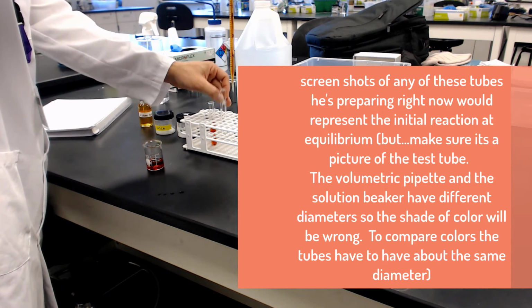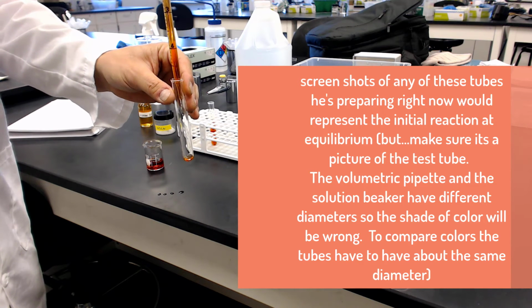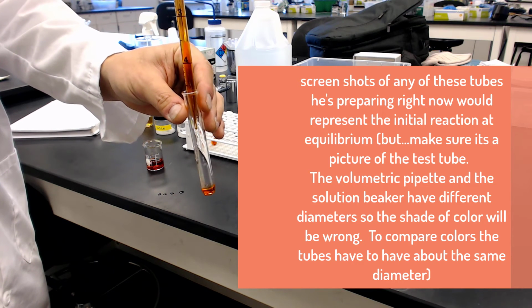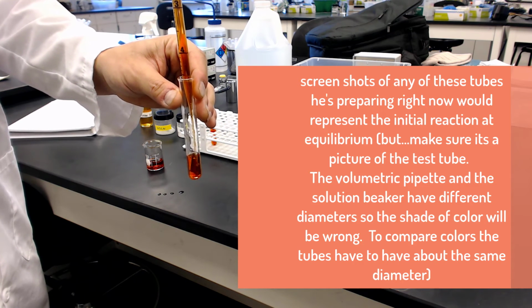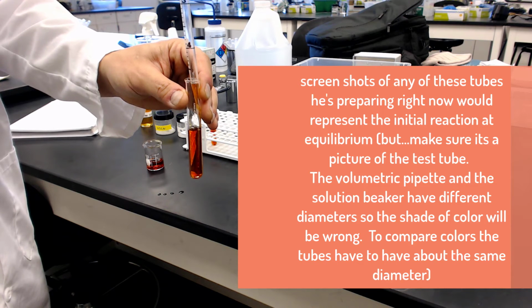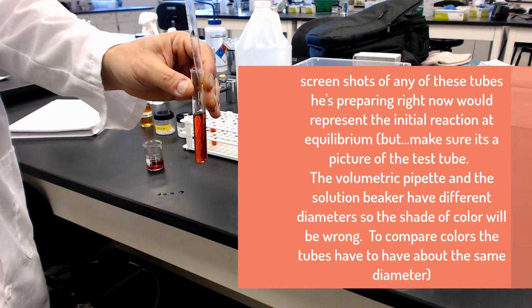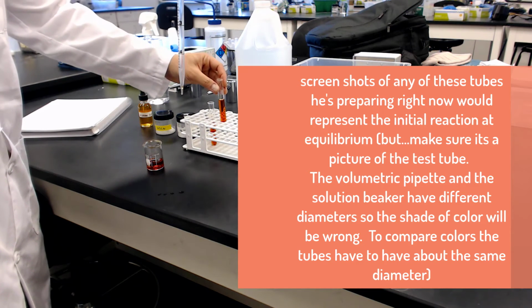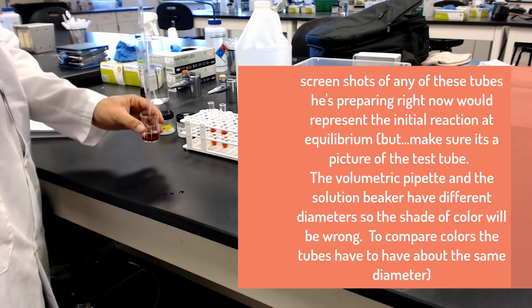Again, if you want to be safe, then you would have followed more of Jared's procedure, where in the last lab you saw him very carefully prepping the dispensing pipette. He would have probably been a little more careful prepping the test tubes that you're going into. But again, this is clean glassware, and we're just doing equilibrium reactions. So this is going to work pretty good.